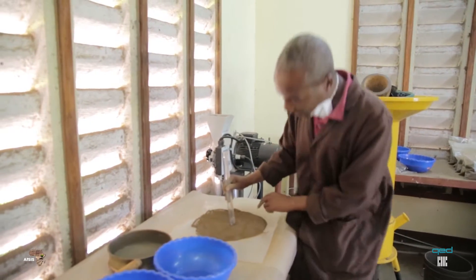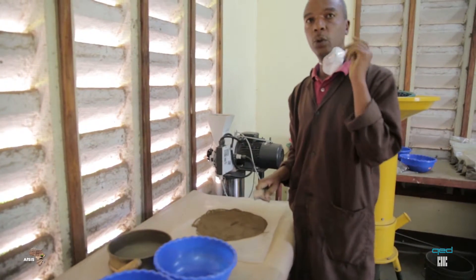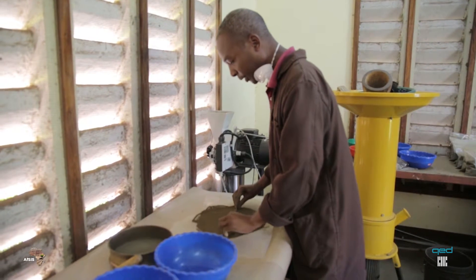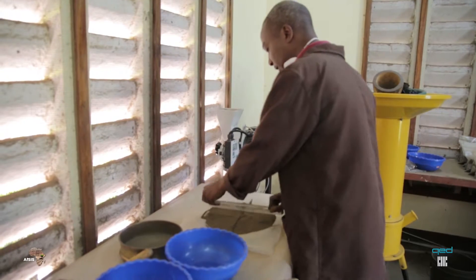Once you see here, it is two centimeters already. Then you divide the sample into two parts. You take a ruler, you put it here, you cut, then you cut this way.